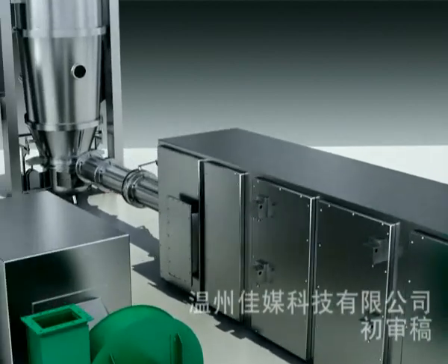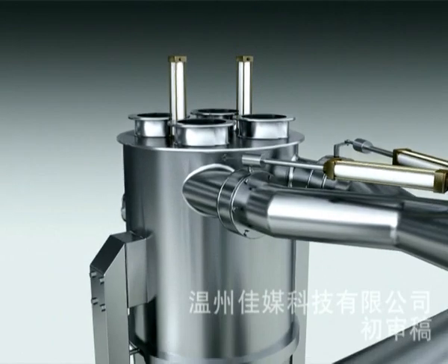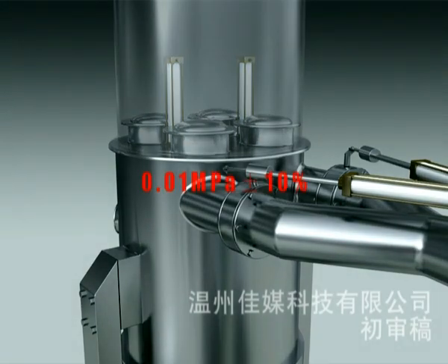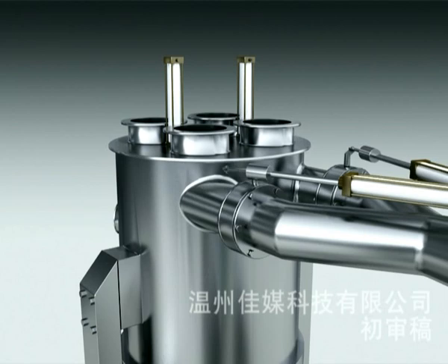The main machine of the fluid bed. The main machine consists of hot air cabinet, fluid bed, expansion chamber, and powder collecting chamber as stated above. Rupture discs are supplied on the top of the main machine for explosion-proof type. They will burst at a pressure of 0.01 MPa plus or minus 10% automatically, and then the air will be released to the area specified so as to protect the operator.